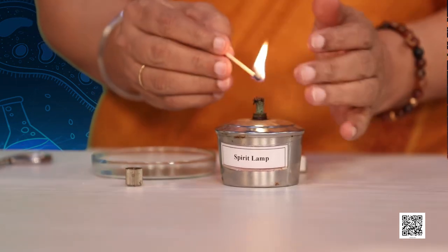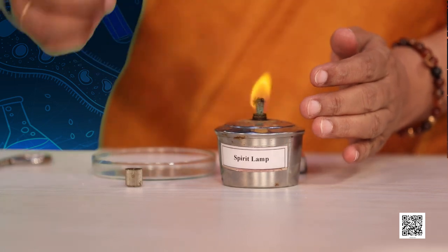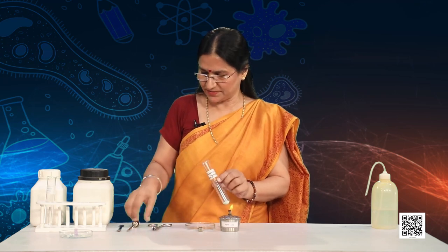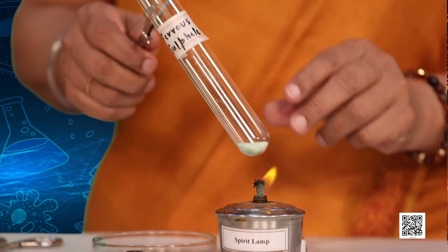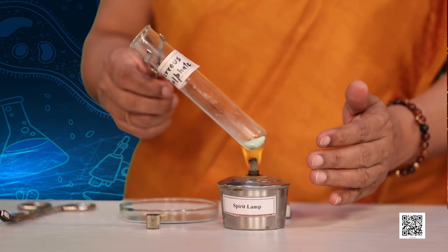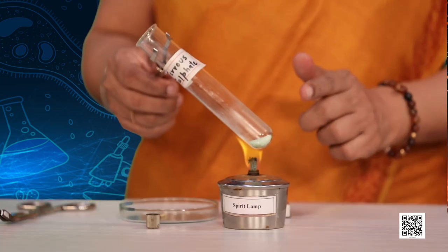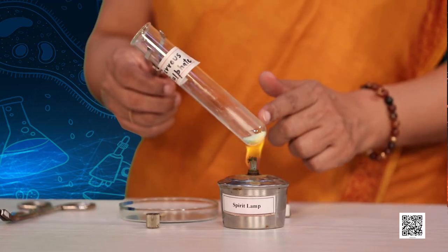Whenever you are doing such experiments, make sure you are doing so under the observation of a teacher. Here is the boiling tube with ferrous sulphate crystals. Let me hold it with the test tube holder and place it over the flame. Now recharge your observational skills and observe the change in colour of the crystals carefully.